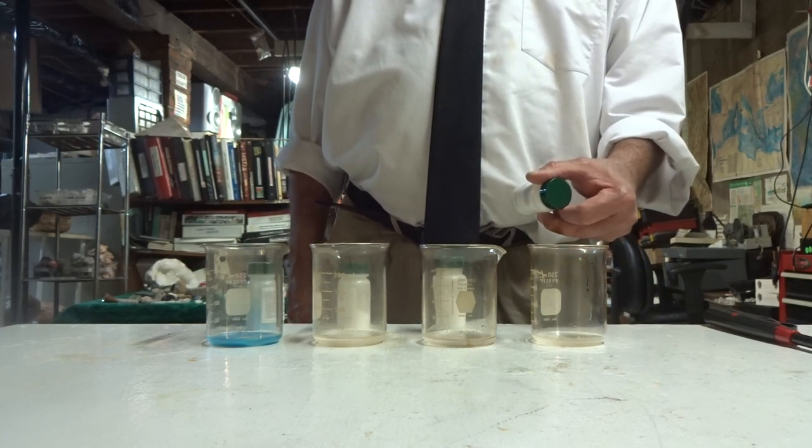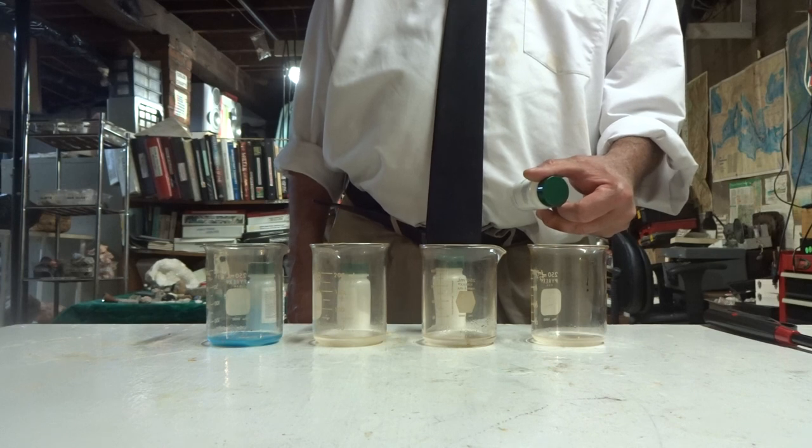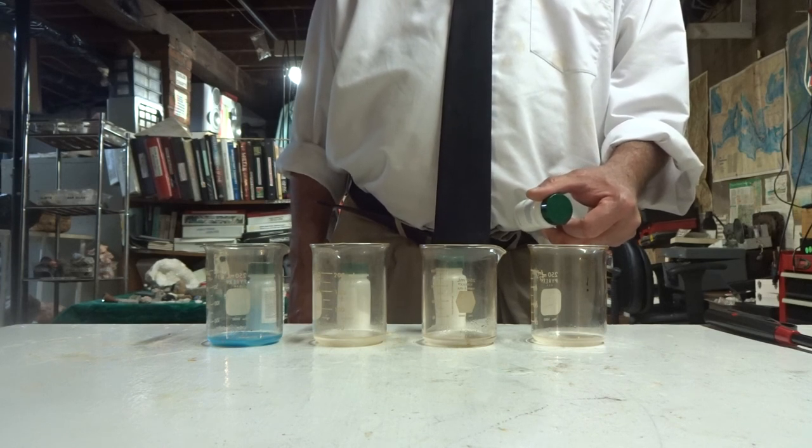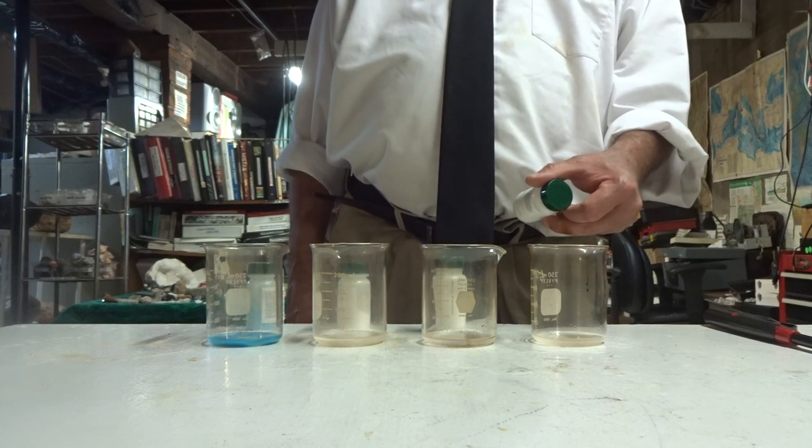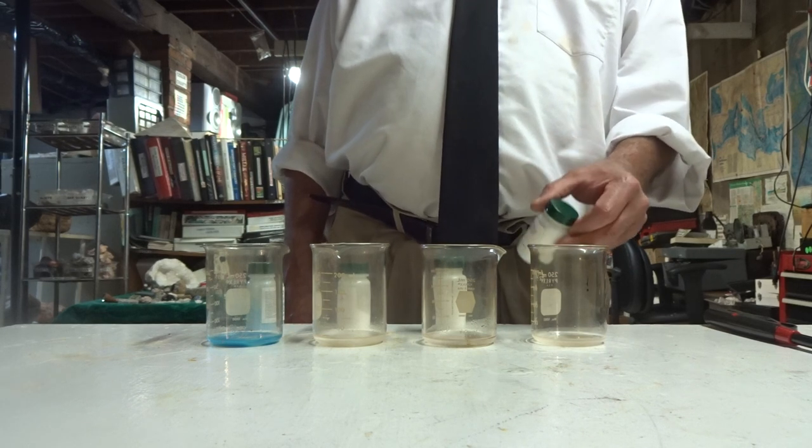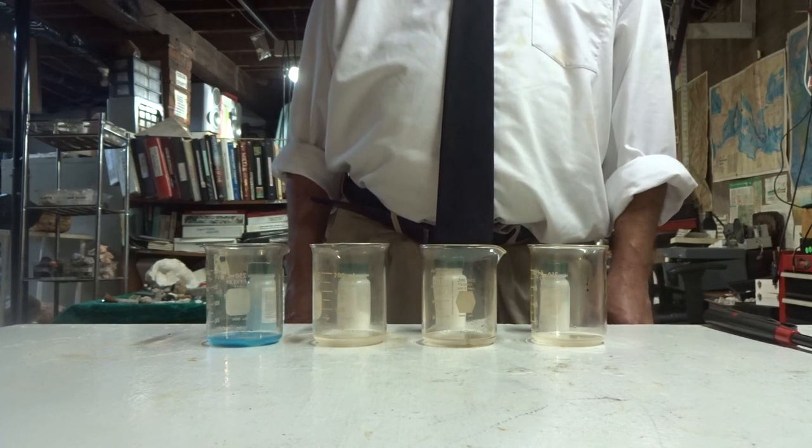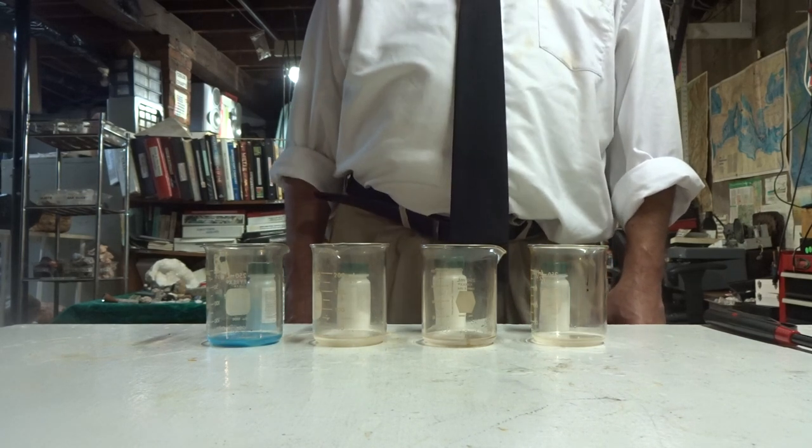In the first one of sodium chloride, the cation sodium is the color that it's going to burn. It's going to burn sodium's color. The chloride and the anions do not affect the color. We can't see any color change from them.